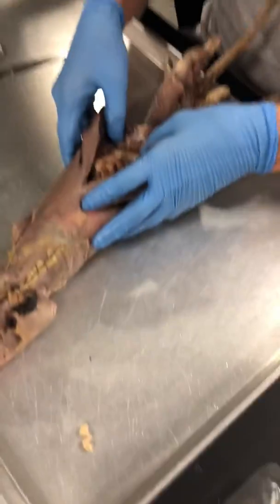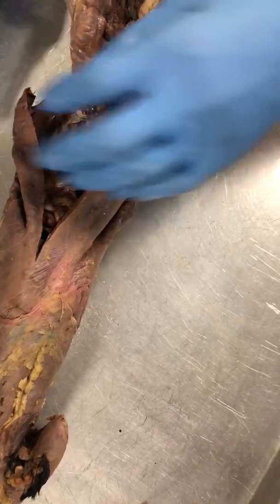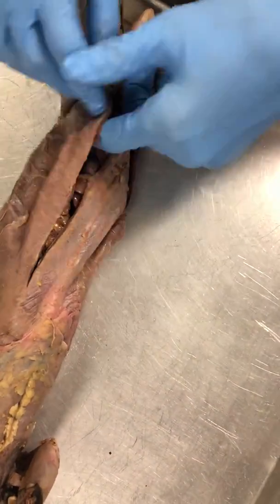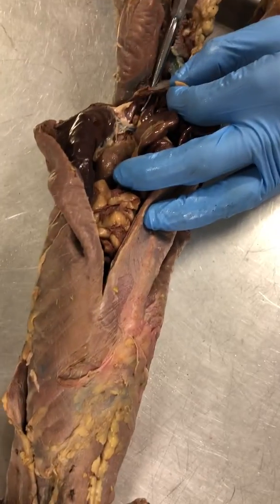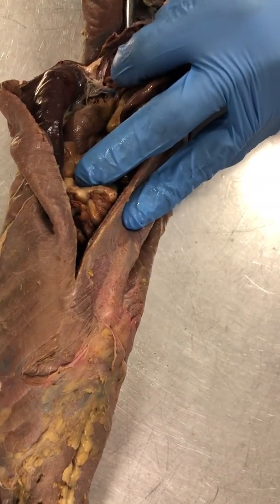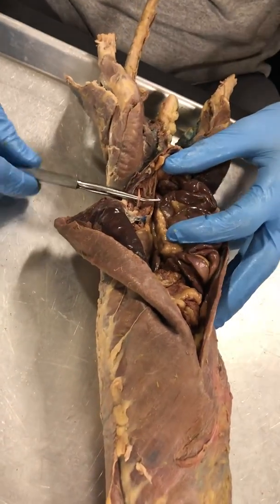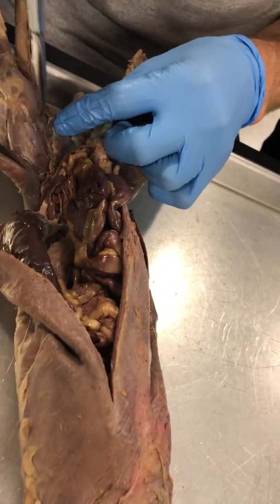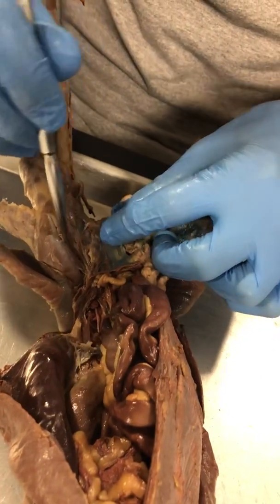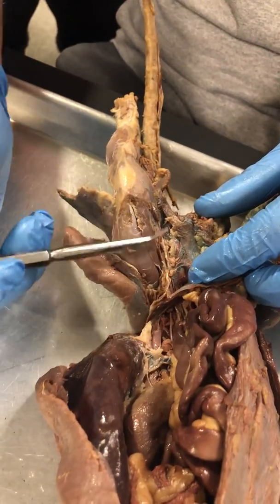Okay, so not too bad, right? Four nerves. And then we're going to go down into the abdominal cavity. So the psoas muscle — the iliopsoas muscle — is a hip flexor. Just make sure you're not cutting any intestines. Clear your way. Cut through that abdominal cavity. Really, probably the best way to do it is find the inguinal canal — from the outside of the abdomen into the abdominal cavity, going through the inguinal canal. The femoral nerve goes through that inguinal canal. So, kind of buried in that psoas muscle, you'll find your femoral nerve. And then if we go down into the quad, next to the vastus medialis, we'll see this bundle of neurovasculature. There's a nerve part of that — that's the saphenous nerve.